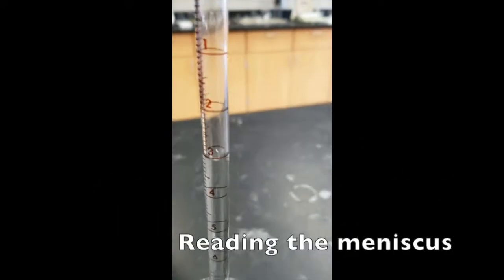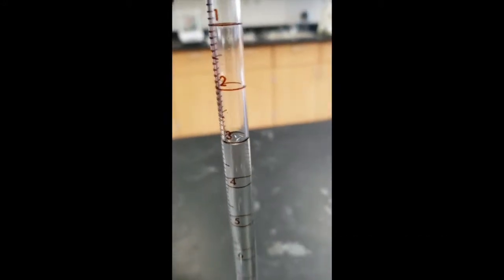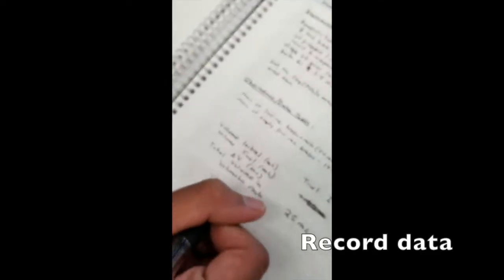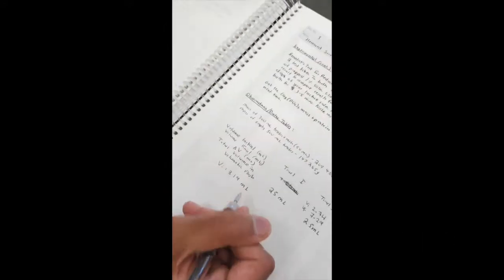Should be read at eye level, and in our case it is 3.19 milliliters. So 3 minutes left until that's over. Everything's gonna be cleaned up and out of here. Okay. So our VI is 3.19 milliliters.